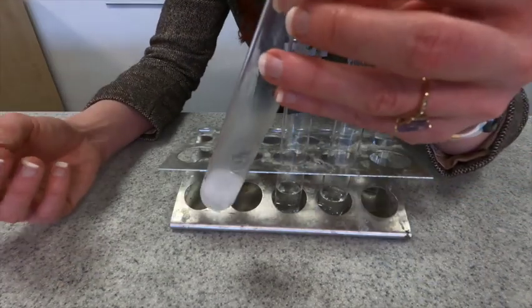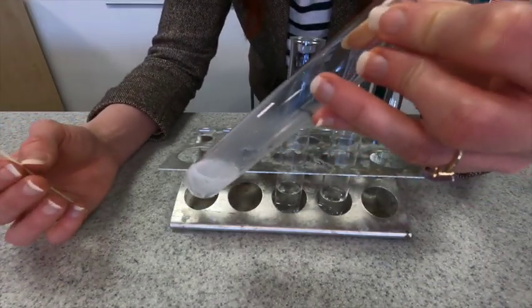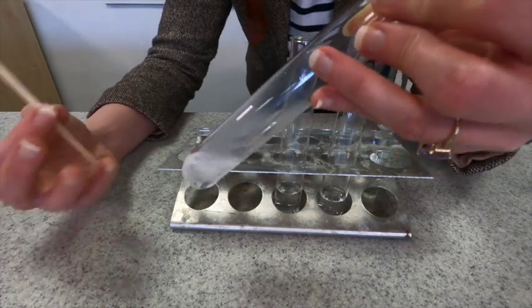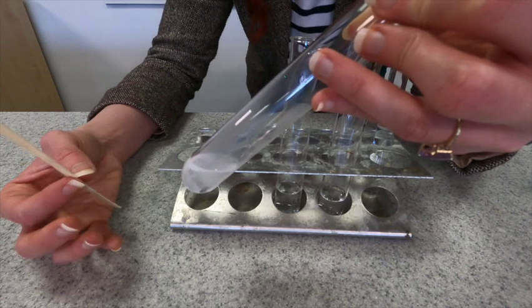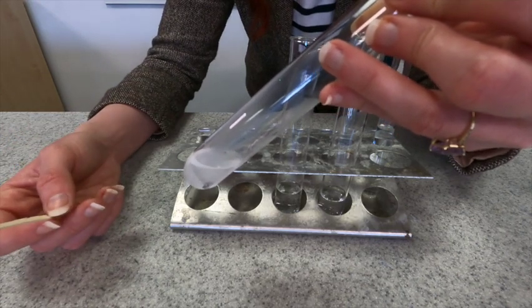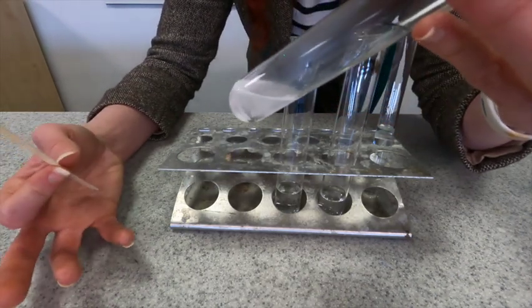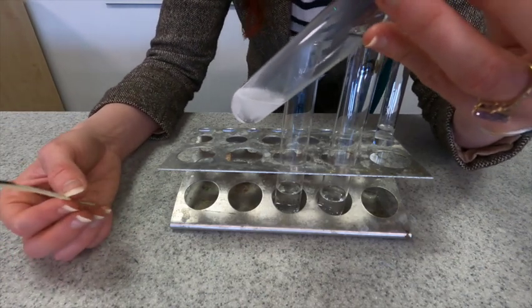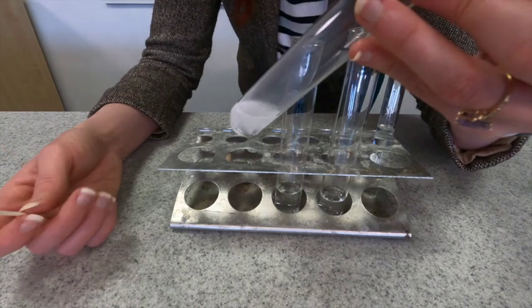There is some hydrogen being formed but it's being formed at a much slower rate than it was with the hydrochloric acid, so it's taken a long time to be able to build up enough to do the squeaky pop test. But you can see it's still reacting and it's still producing hydrogen. We've got the same product but it's at a much slower rate.